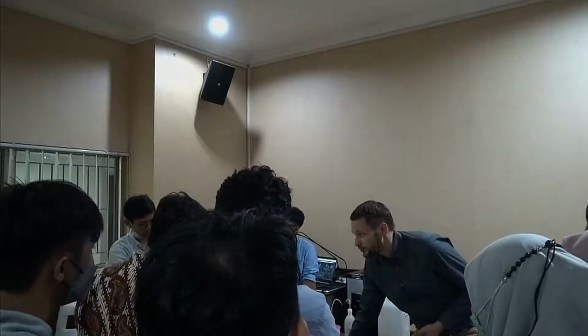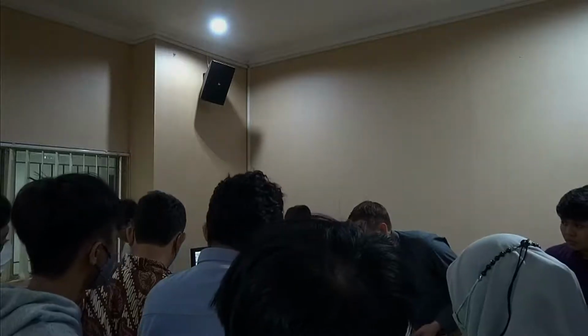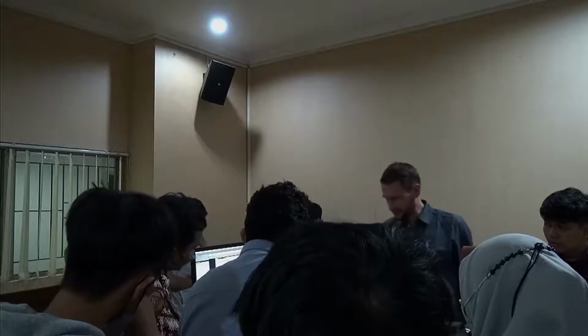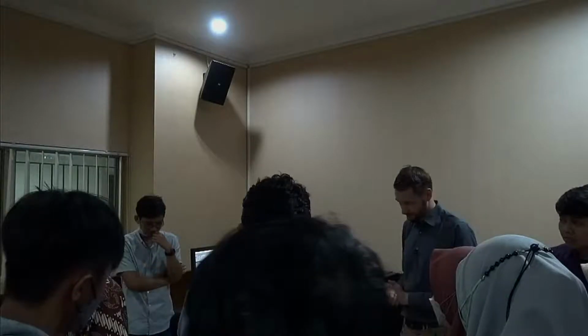So let's now say we have a measurement which we also want to send somebody or which we want to use. What we can do is, we have our tables already in, real quick and dirty, just print, select a report. It's all customizable also in the software, the report's editable. And then you have a PDF with your chart, with your values. You can save it, you can use it, you can publish it if you want. So that's basically the next step.